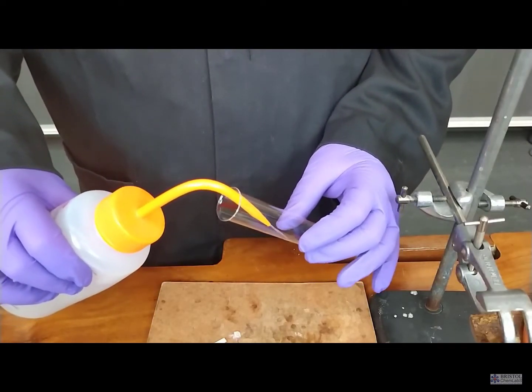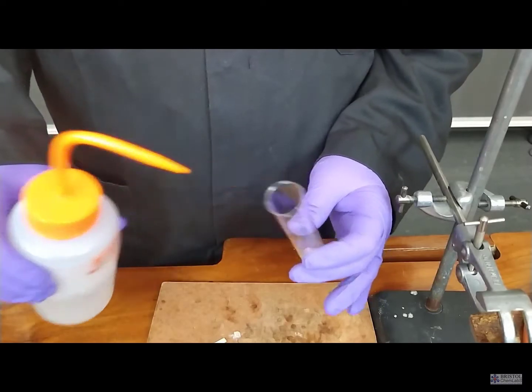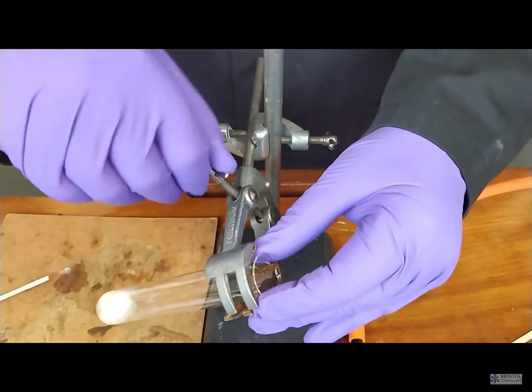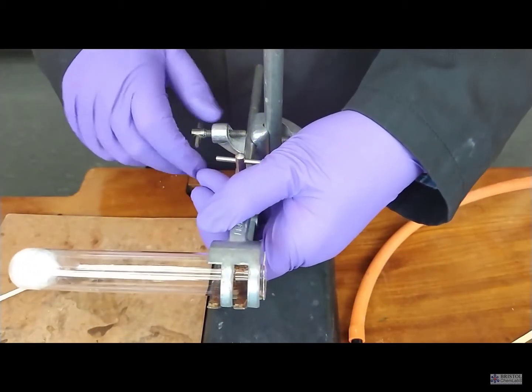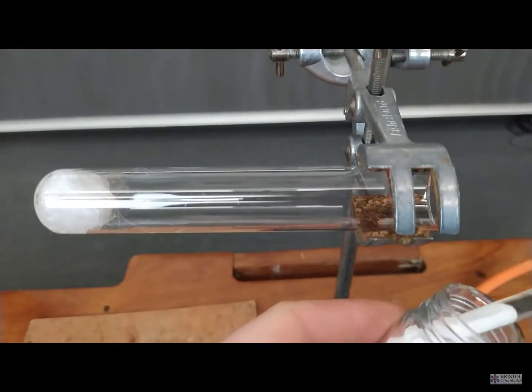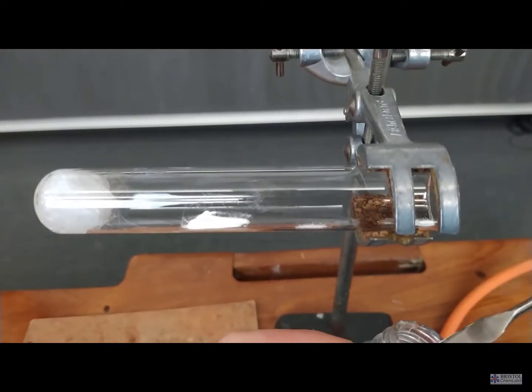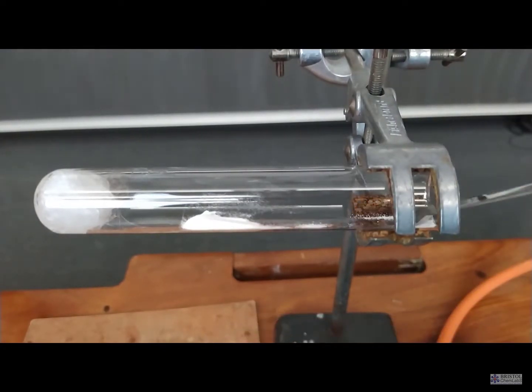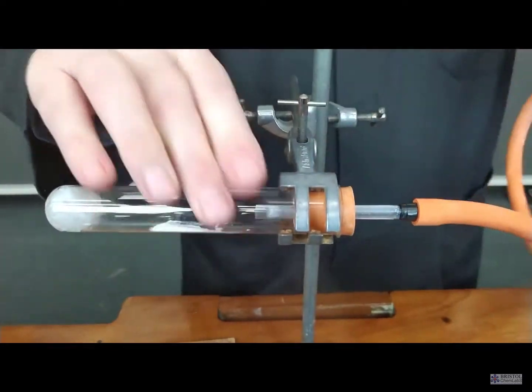The first thing to do is to get some ethanol into a boiling tube. Now, as the boiling tube has to be placed horizontal, we're putting some mineral wool or glass wool to act as a reservoir for the liquid into the bottom of the tube. Then we're sliding in the catalyst—the catalyst here are aluminium ions in the form of aluminium oxide. Aluminium oxide powder can be substituted for porcelain; there's enough aluminium in broken pieces of porcelain dishes that you might use for recrystallization to do this reaction.